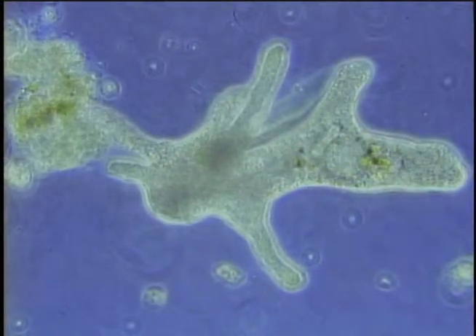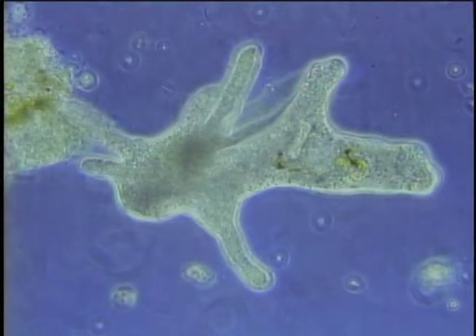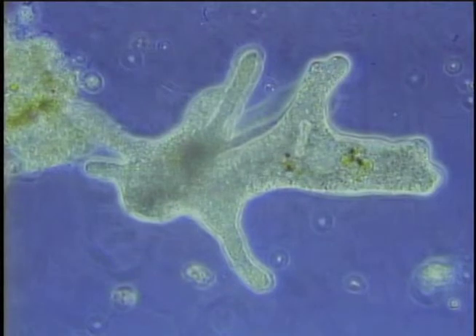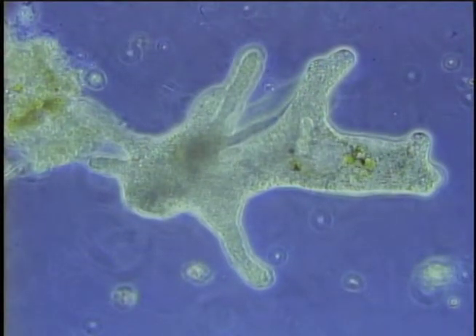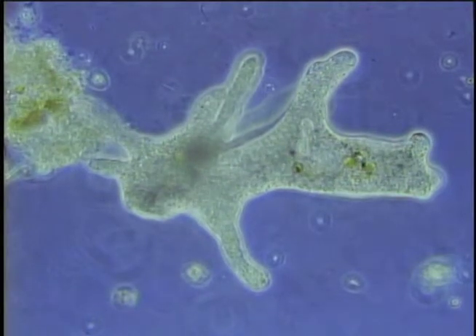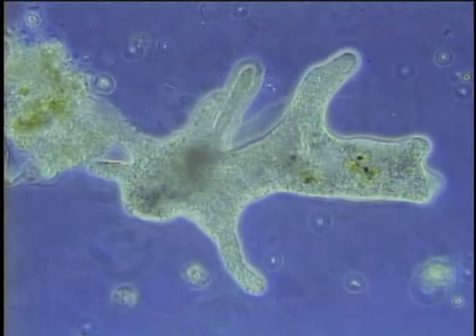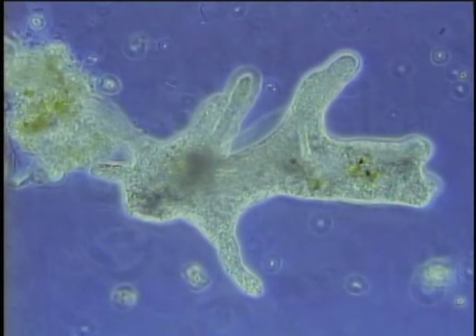One of the major advantages of phase contrast microscopy is that living cells can be examined in their natural state without being killed, fixed, and stained. As a result, the dynamics of ongoing biological processes in live cells can be observed and recorded in high contrast with the sharp clarity of minute specimen detail.